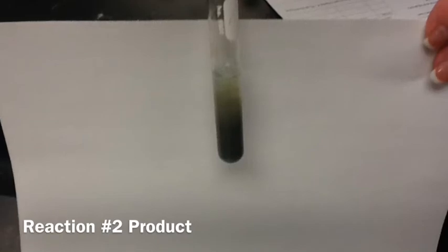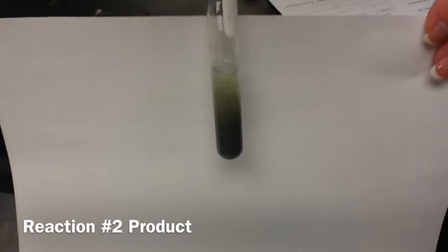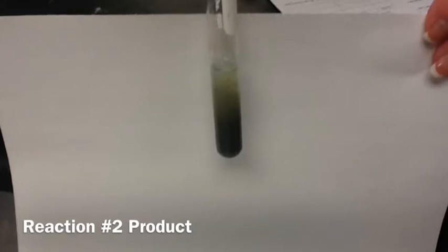Sometimes this reaction doesn't work. That's okay. It doesn't necessarily mean you've done anything wrong, and starting over should do the trick. If you have to start over more than once, please let me know and I will assist you.